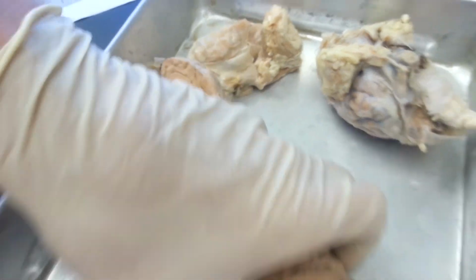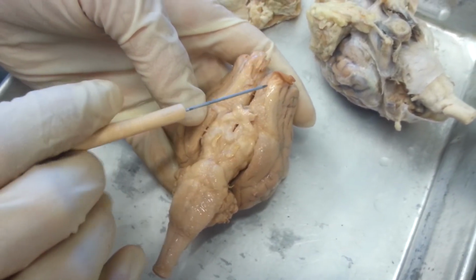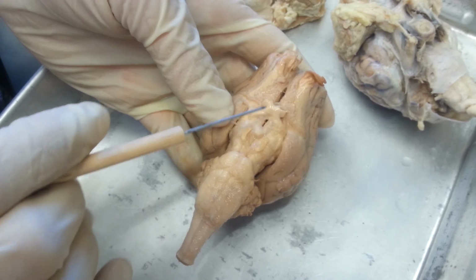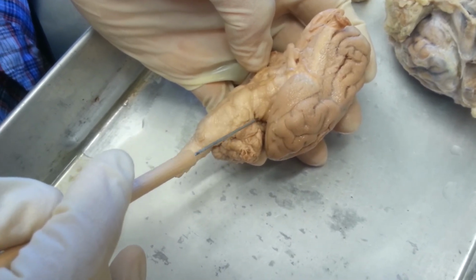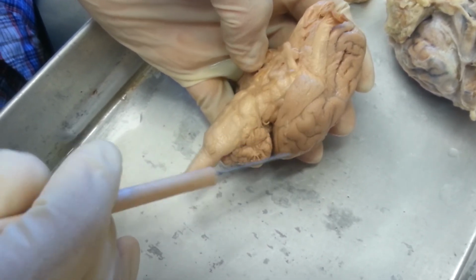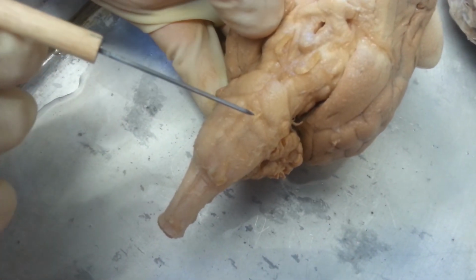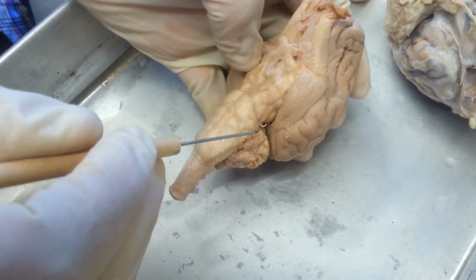You also have to know the cranial nerves. I'm going to identify as many as I can on this, but this one doesn't have all of them. I'll show you the general locations though. This is the first nerve, the olfactory nerve. This is the optic nerve, and this is the oculomotor nerve. The fourth one is on the side here. This is the trochlear nerve. The fifth nerve, you have a bunch of them all together here. The fifth one is right here, and then the abducens is up here. You can barely see it, but there it is. The fifth is the trigeminal nerve.